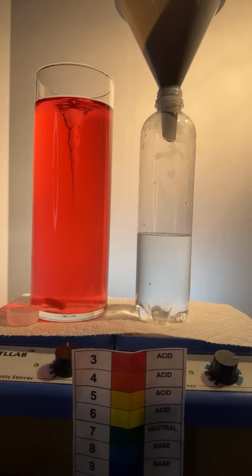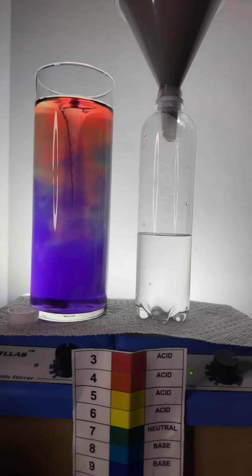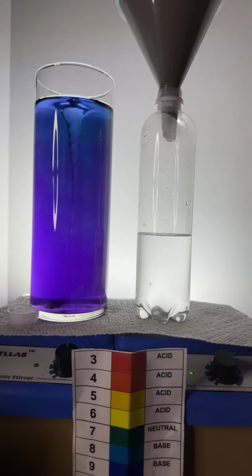Here, let me add a little base over here while you're waiting so we can see something pretty going on. I apologize right now. I'm not going to be able to see much of the comments because I am trying to get a bottle of acetone open, and it looks like I need a screwdriver to do it, but there we go. I used the end of a hammer instead.